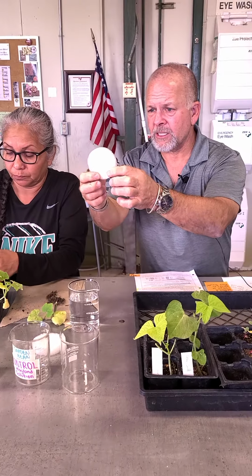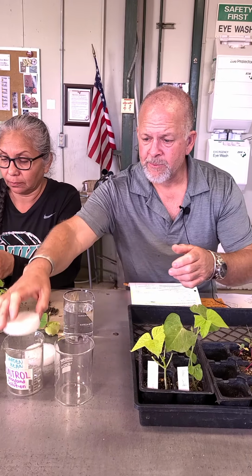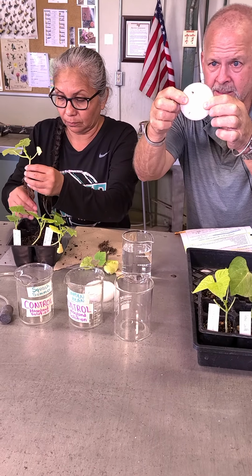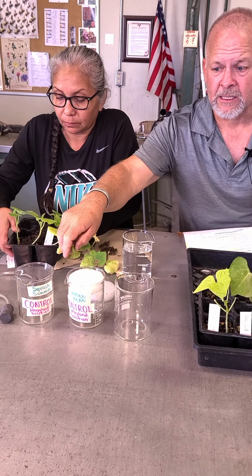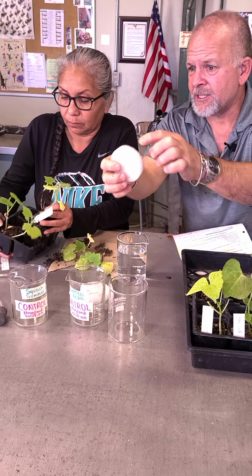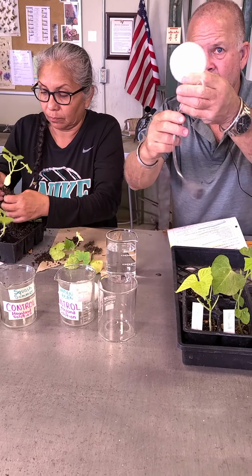We've got these foam discs, and we're actually doing our hydroponics in these beakers right here. So these foam discs, we've cut them in the past to fit these beakers just precisely. So what we're going to do is we made a slit in it like that, and this is where the plants are going to go. Belinda will show you that obviously in a second, but this is an air stone.